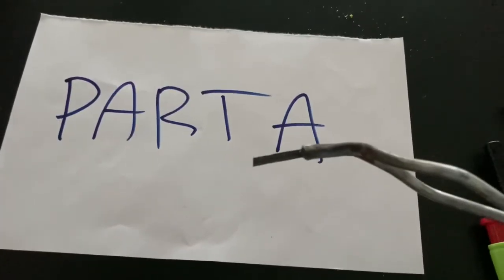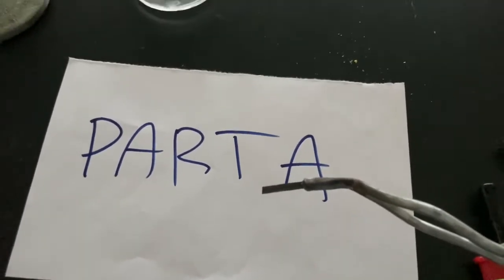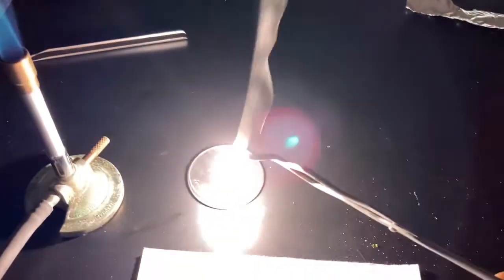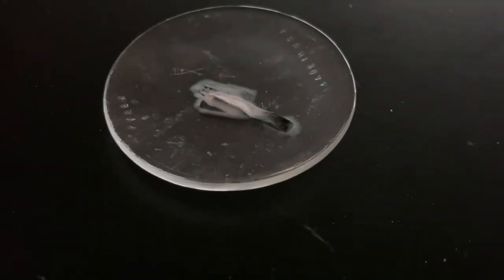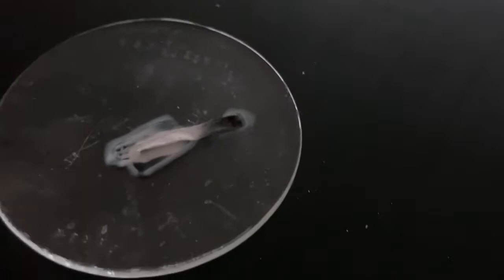All right, to get this reaction going, we are going to need to add a little heat, so that will allow the magnesium to react with the oxygen. I'm going to use my Bunsen burner here to get this reaction going. Okay, take a good look at what's left. We see we have this kind of white powdery stuff left, and that would be your magnesium oxide here.